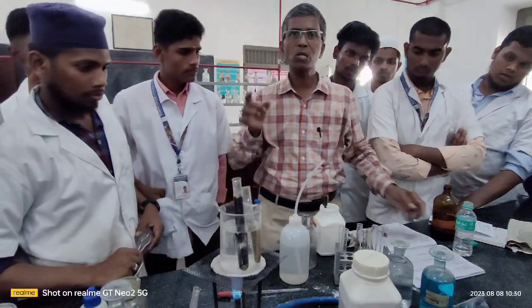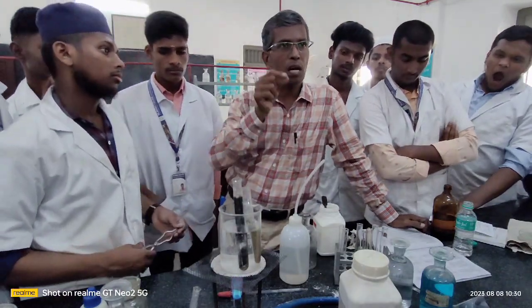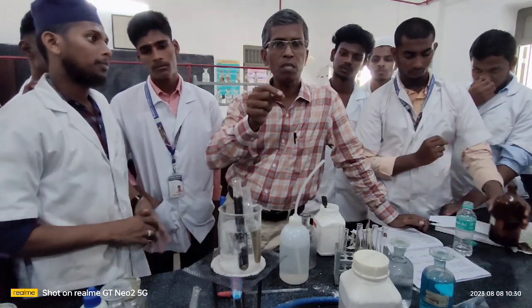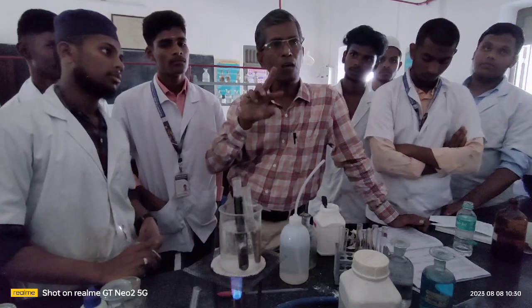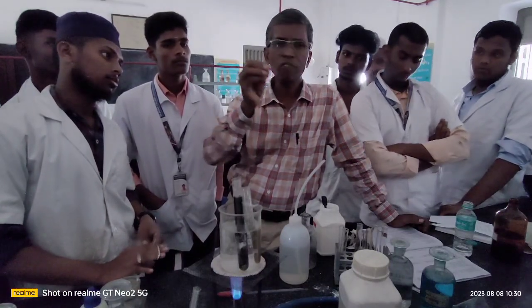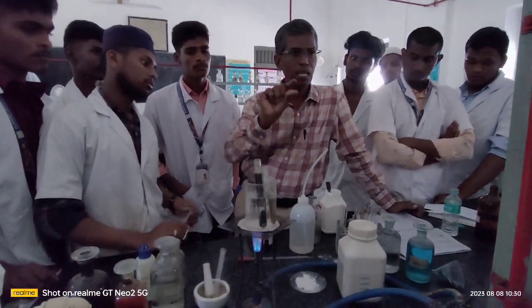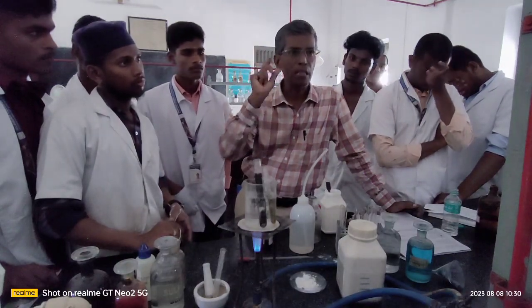And one more test. I told you how to differentiate. I told you very clearly that both aldehyde and carbohydrate respond to the silver mirror test, that is the Tollens reagent test. Then how to differentiate? The differentiation is you go for the Schiff reagent test. You take the organic compound, add a little extra of Schiff reagent, and shake it well.